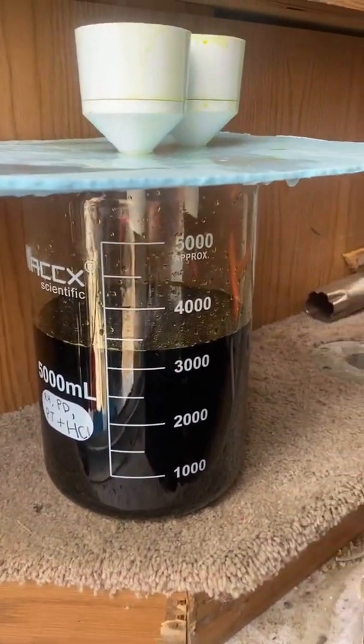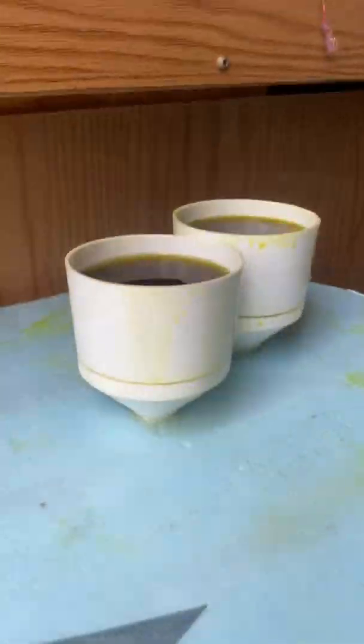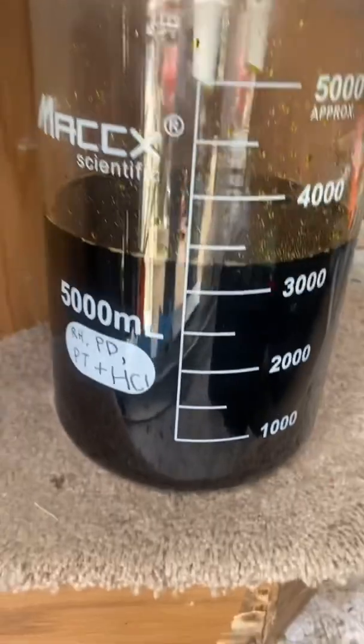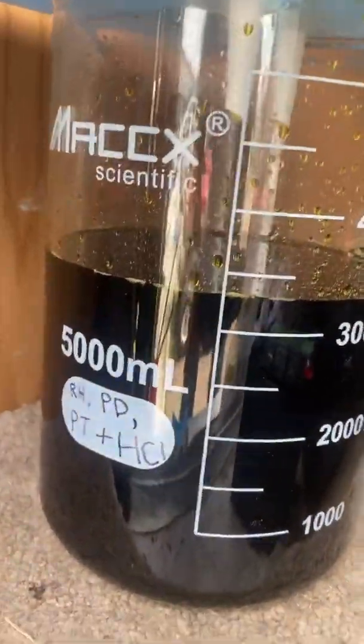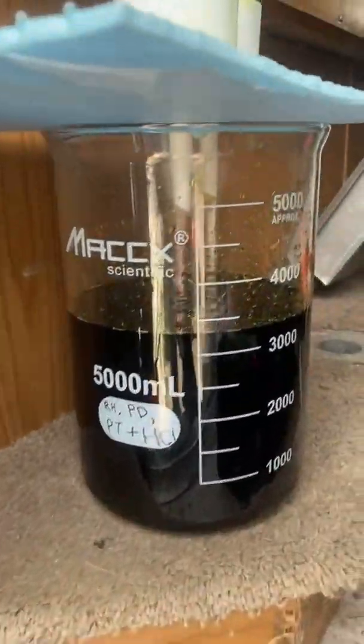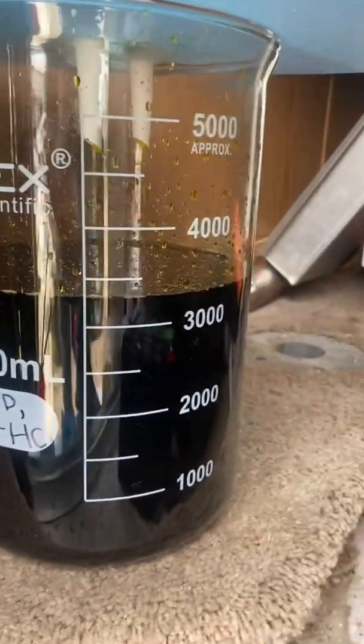My makeshift laboratory. We got almost 3,500 ml in there so far, slowly — about done. This guy's got tape on the bottom of it just to help protect the glass, and I had some around the whole glass on it. But this guy's going from here over to the hot plate magnetic stir. I'm gonna add a little bit of copper powder to help precipitate our precious metals — the base metal crap that's in there — which will help precipitate our platinum out.